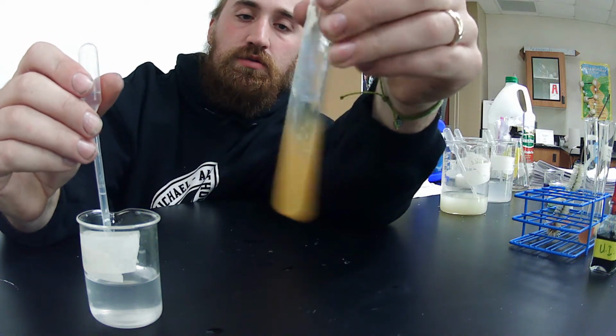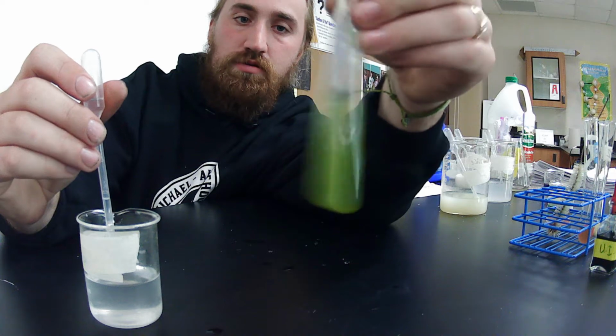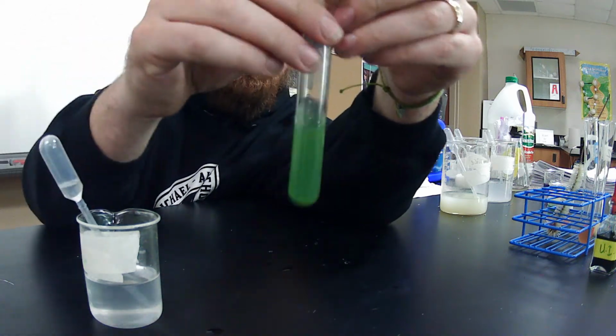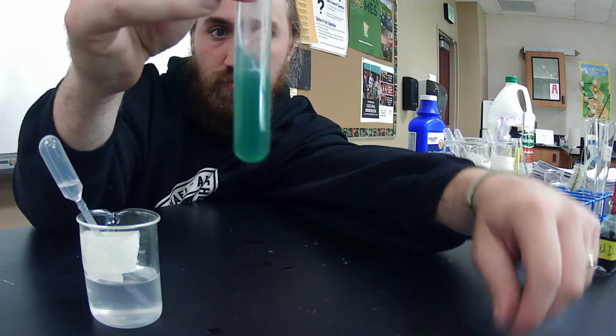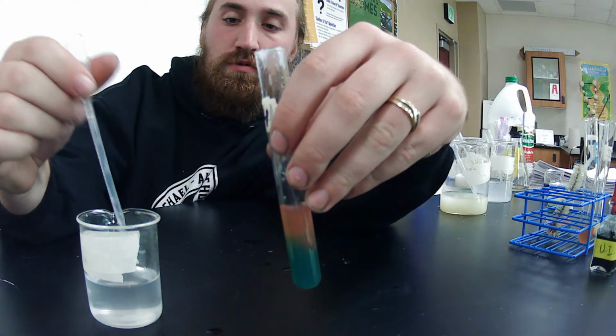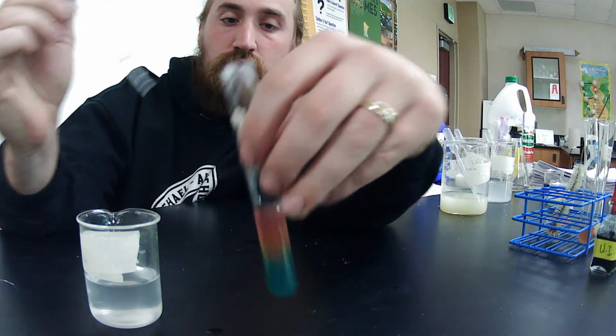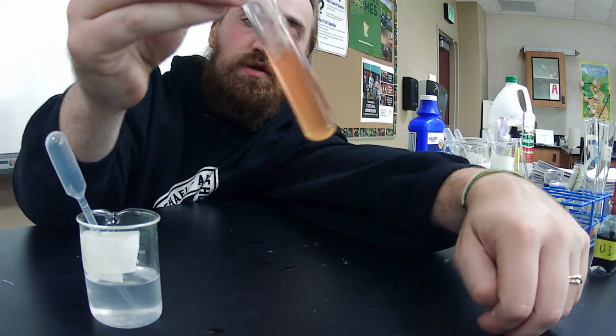Okay, we're getting closer. Is it going to stay? Or is it going to go back? Keep shaking, keep shaking. Okay, it's really close now. It's pretty much almost at neutral. Still a little bit basic. Take a couple more. Mix it up, and bam.